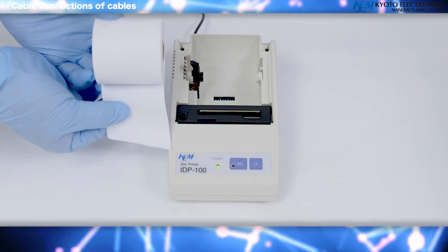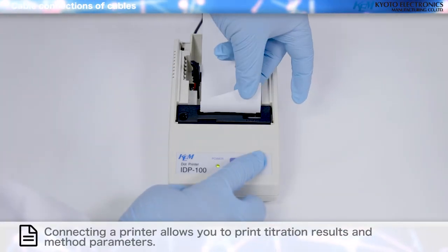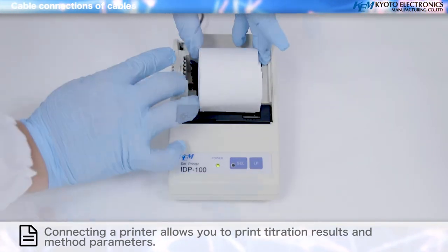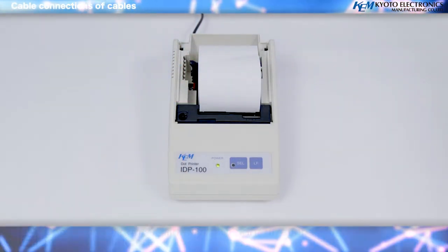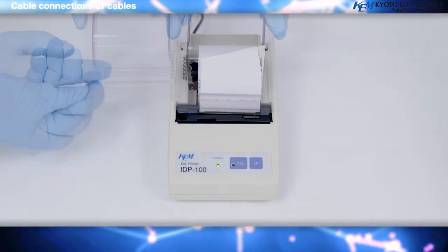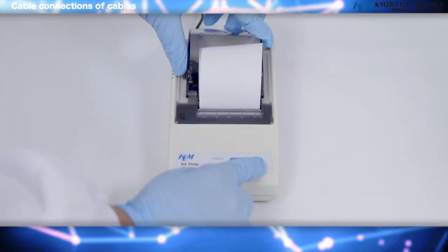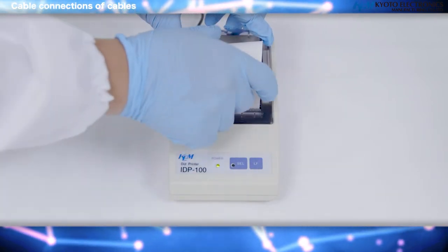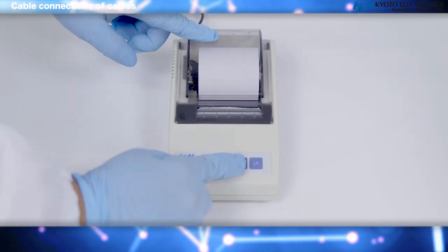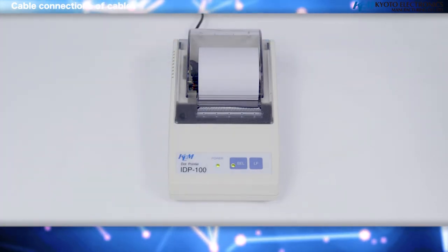Printer connection: connecting a printer allows you to print titration results and method parameters. Load the paper — when the paper is cut on an angle it is easier to feed. Turn on the power switch.